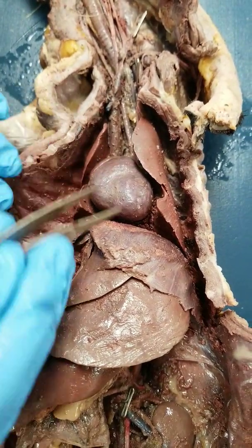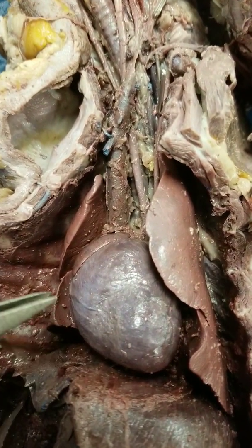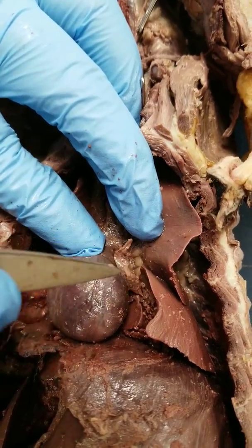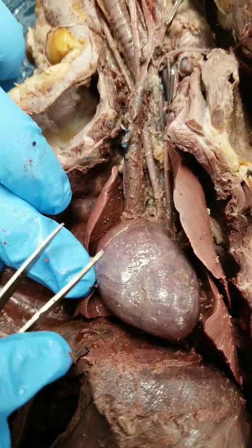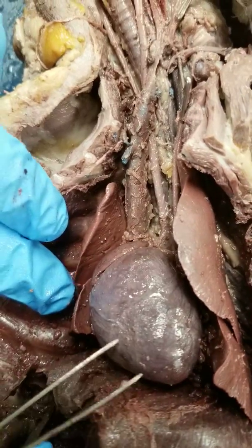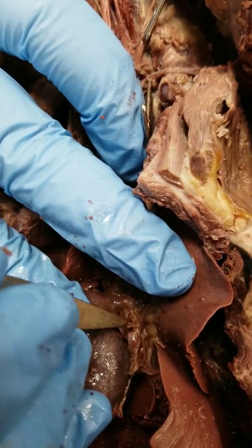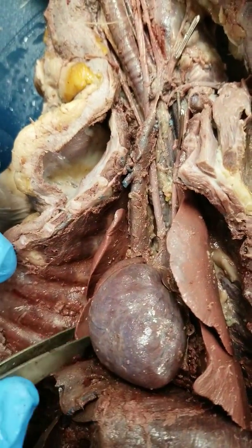When you open the chest cavity, you're going to see the heart. You're going to need to remove the pericardial sac around it — this clear membrane. It's a tough membrane, so you're going to need to cut it with a scalpel, but that way you can see the surface of the heart. The structures you're responsible for are the right atrium and the right ventricle. Here's the left ventricle. The left atrium is going to be around the back — right here, on the back side of the heart. You also have the lungs on the left and on the right.